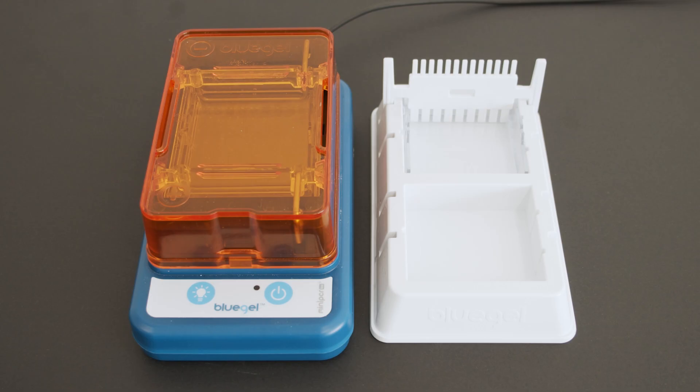The Blue Gel System allows you to cast, run, and visualize DNA gels safely and easily all in the same integrated system. This video will cover the parts of your Blue Gel System, how to run a gel, and how to visualize your results.